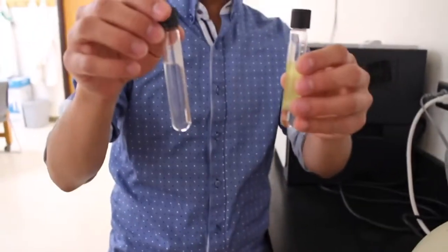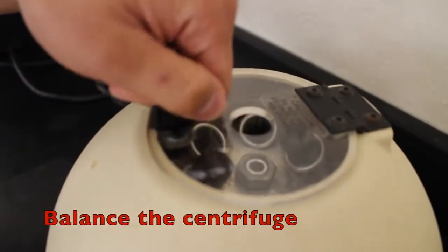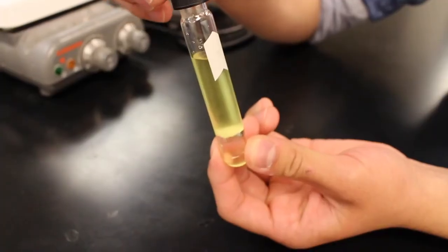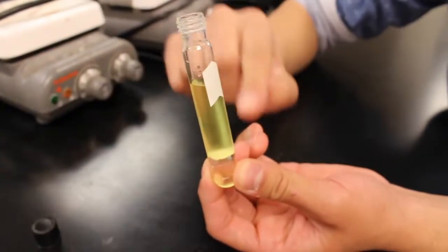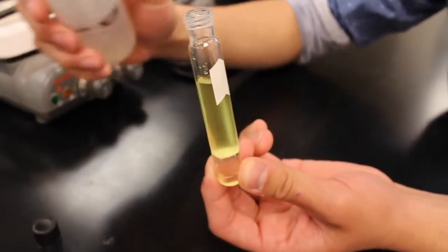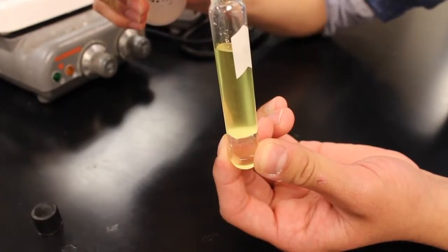When the mixture doesn't separate well, put the test tube in the centrifuge for about 30 seconds. Don't forget to balance the centrifuge using another test tube. Now you are going to extract the organic layer that contains caffeine, but how do we know which phase is organic? To figure this out, add water to the test tube. Whichever phase grows is the aqueous layer.